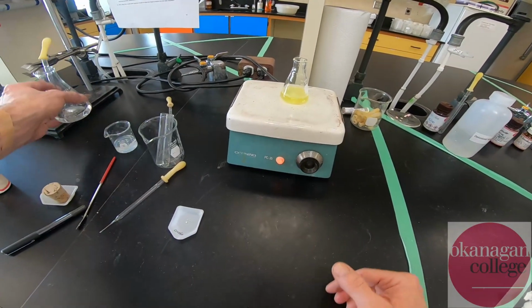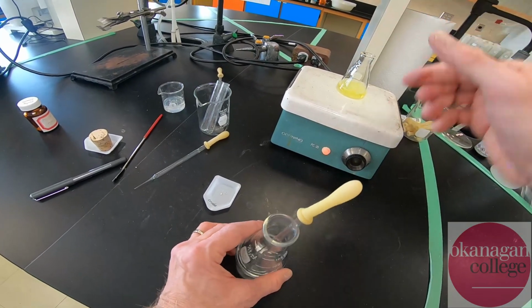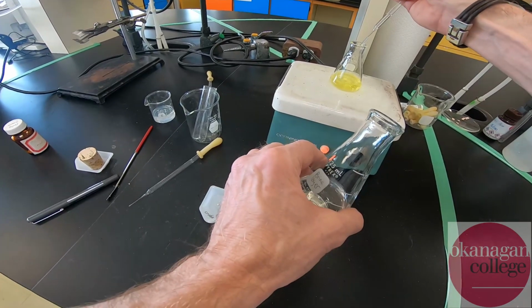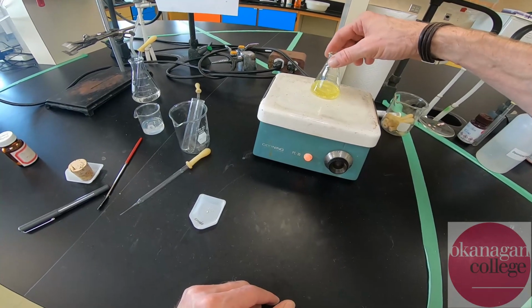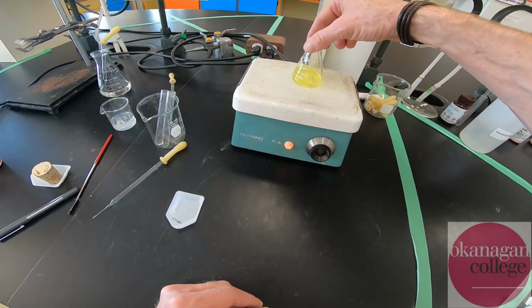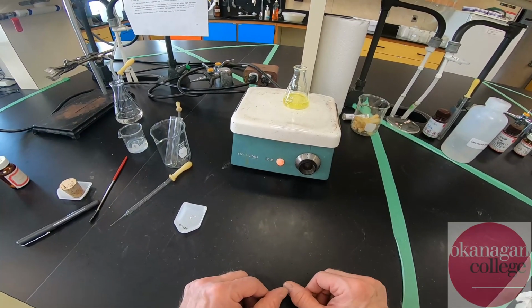Now, it looks like we still have a few boiling chips in there. Those will not dissolve. Those are the big chunks in there. And for the most part, I'm just going to add 2 more pipettes worth. And what doesn't dissolve in those extra 4 mils, I'm just going to leave. But you can see here a couple large boiling chips, and just the smallest number of flakes of undissolved material. Okay, so I'm going to bring that up to a boil, stop it, cool it, ice it, filter it, and we'll be done.